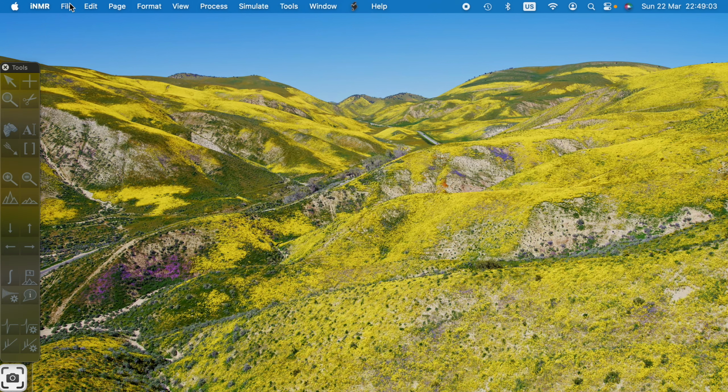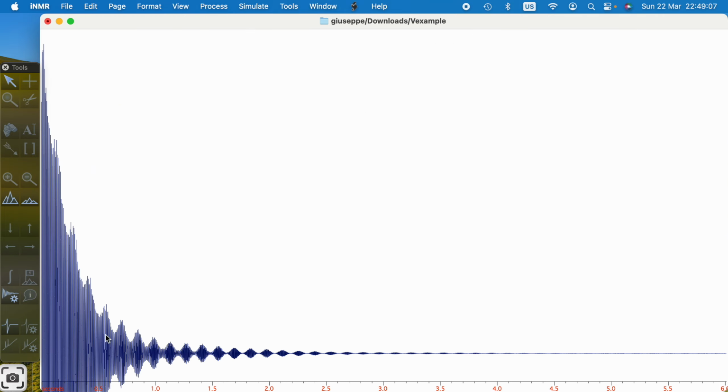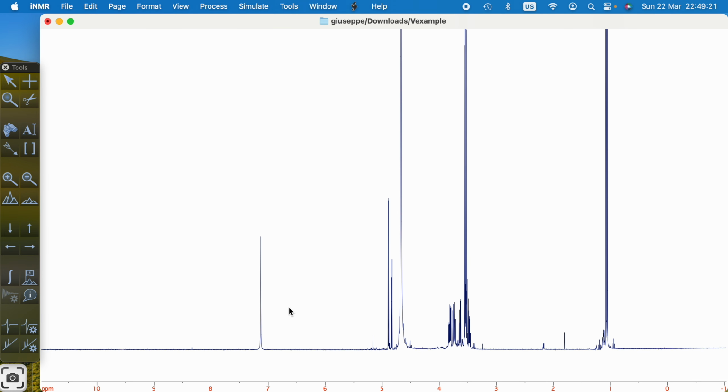Open a spectrum, Fourier transform. This is the automatic phase correction. It looks good, but it is not. Use the mouse wheel to increase the volume.